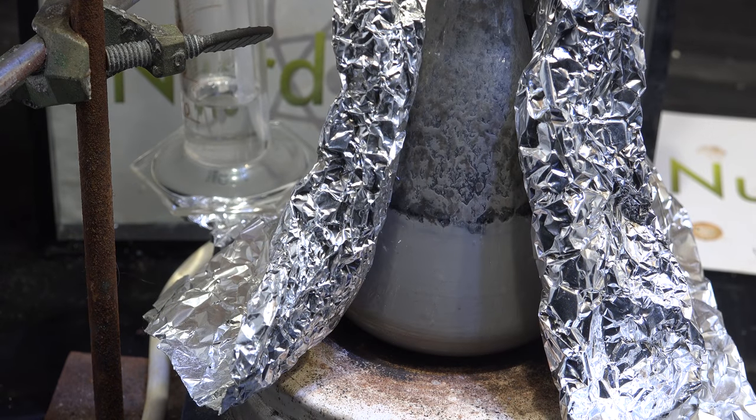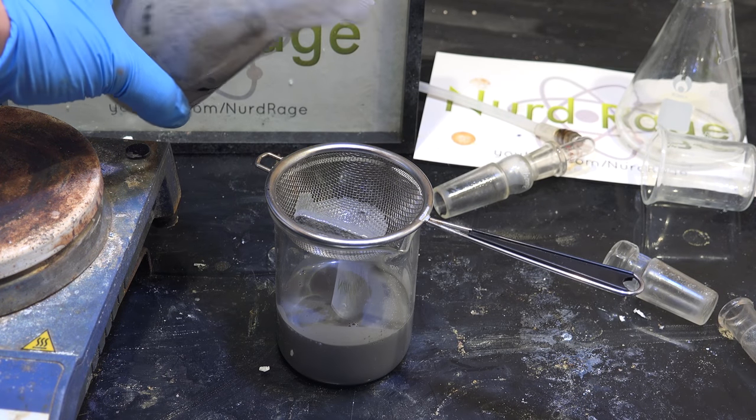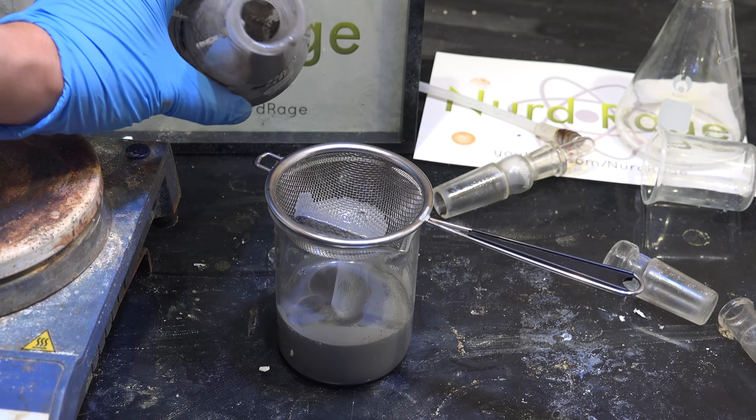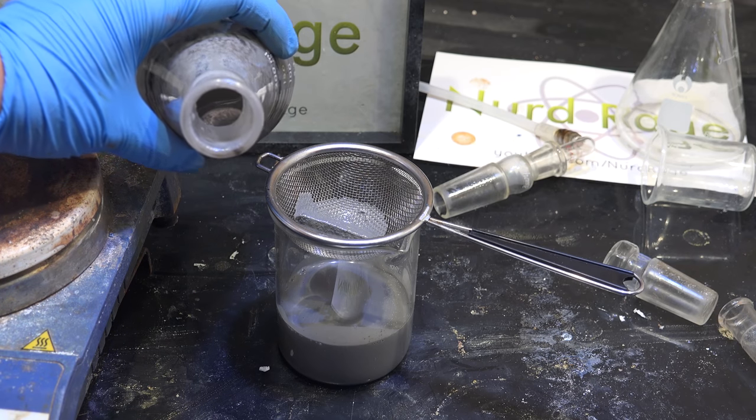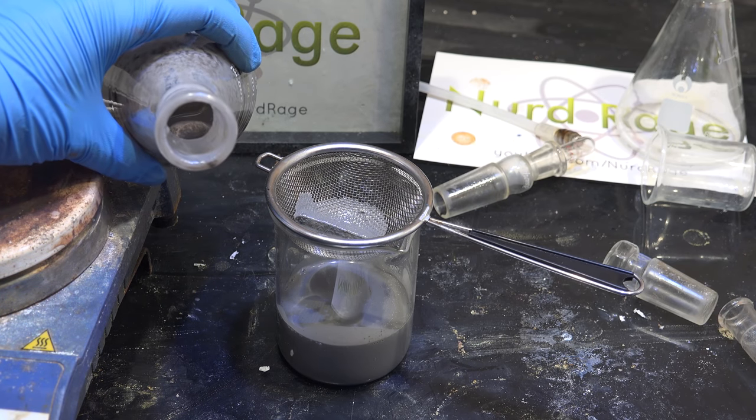And after reacting for several hours we did indeed get sodium production. It was slower than usual but that's probably because of insufficient water removal by the aluminum. I process the reaction as usual and notice that the aluminum doesn't mix in with the sodium. This is a good thing actually and means that the sodium is relatively aluminum free.